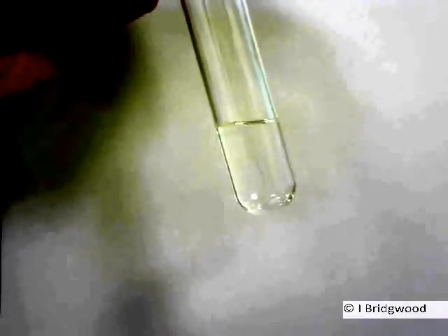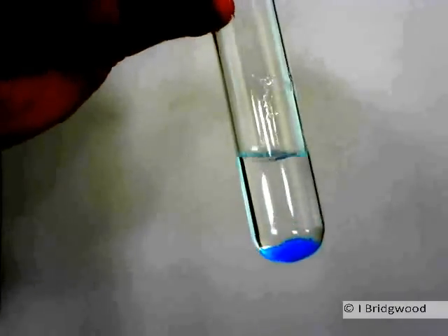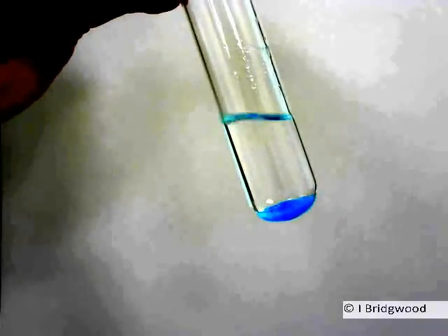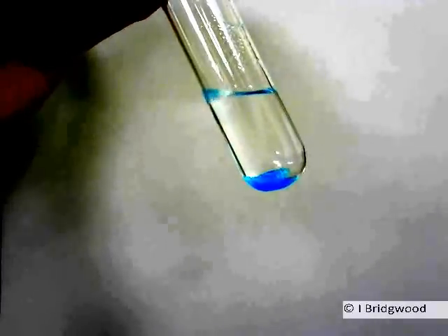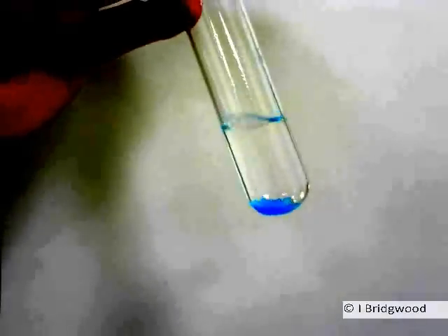What happens if I take an ionic compound, an ionic solid, and add that? I'm going to take some copper sulfate. There you can see the copper sulfate sitting at the bottom. If I give it a shake, you can see that the copper sulfate is completely insoluble in the hexane. It's not going to dissolve because there's no way the interactions between the ions in the copper sulfate solid are going to be replaced by interactions between the hexane and the copper and the sulfate ions.